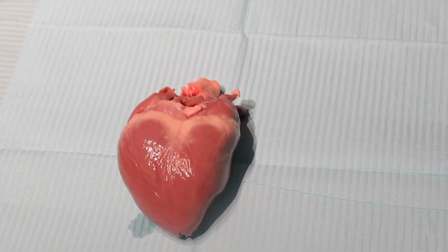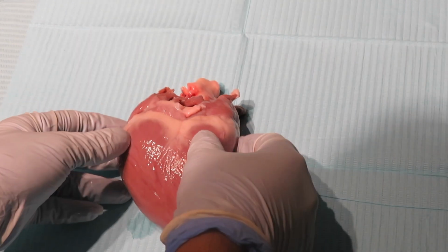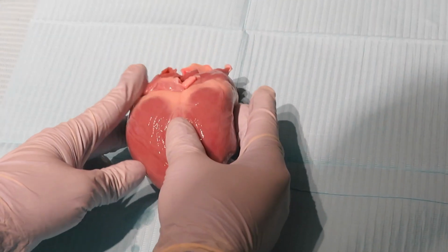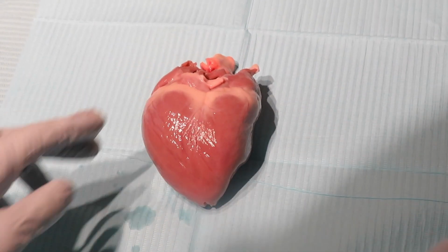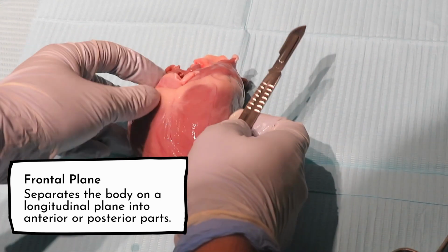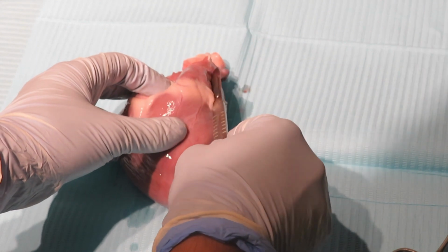However, we will extract and examine the heart because I recall that my father mentioned to me, what if there is a massive clot somewhere inside the heart that may cause serious life-threatening problems and even death of this piglet? So to know, we will cut along the frontal plane and describe what can be seen inside the heart using this type of incision.